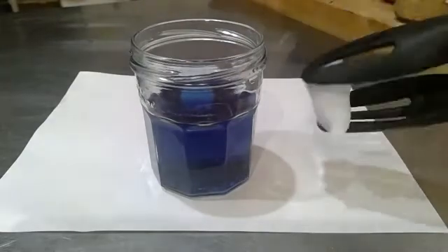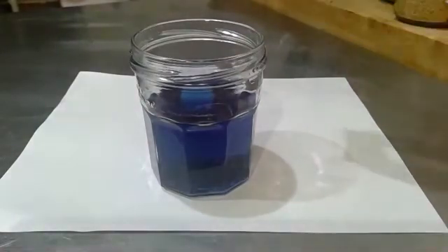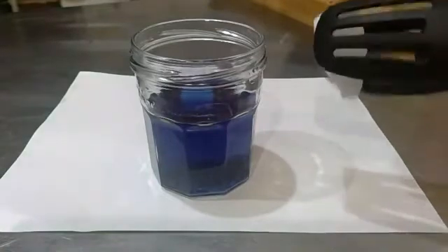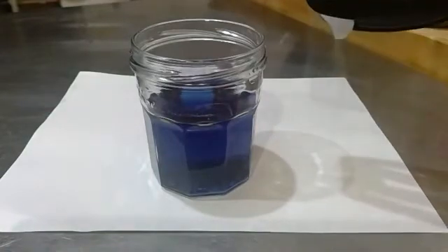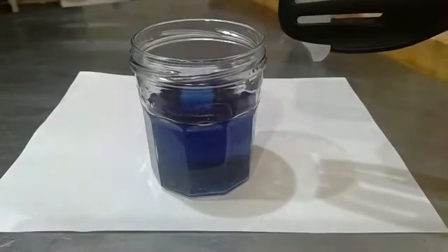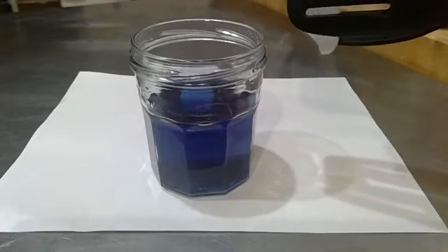Dry ice can really burn you. It is made out of carbon dioxide — it's solid carbon dioxide. You can see that it's kind of smoking right now. That's called sublimation.